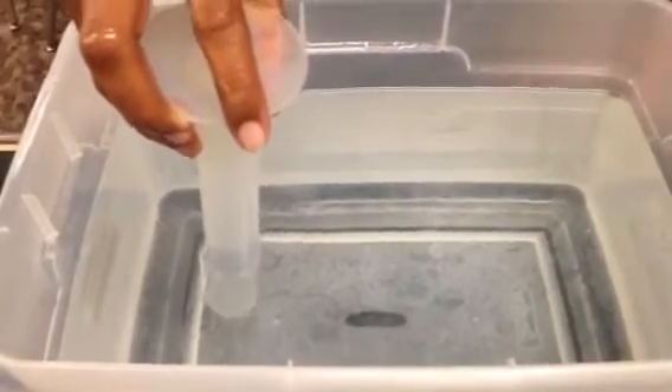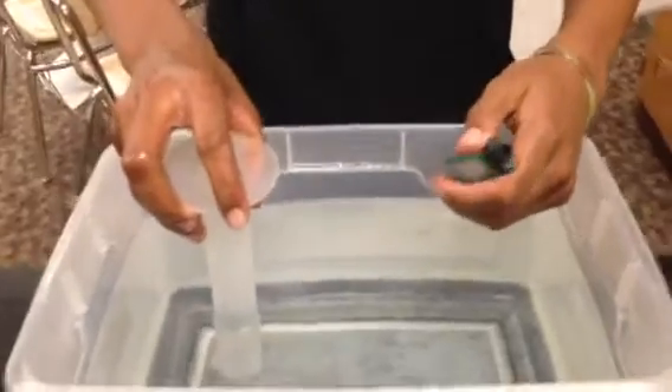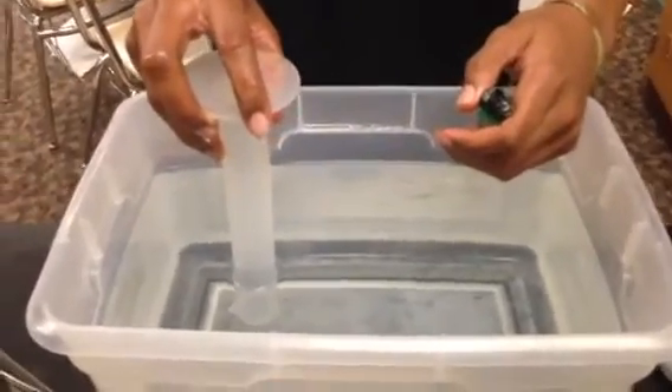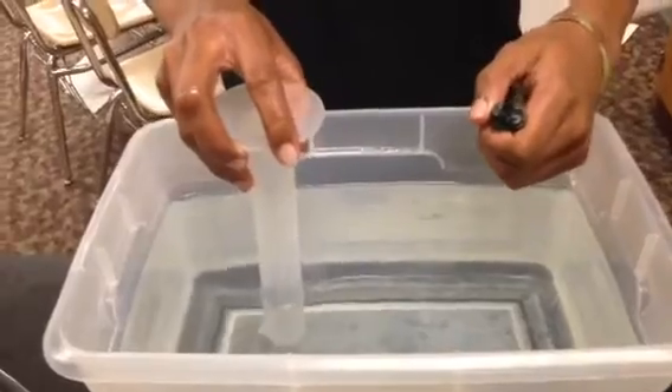Now you're going to take your lighter. The sparker isn't on the lighter anymore, so all we can do is release the butane — we can't light it. In fact, in this lab there can be no candles, no source of flame whatsoever. That is not safe.